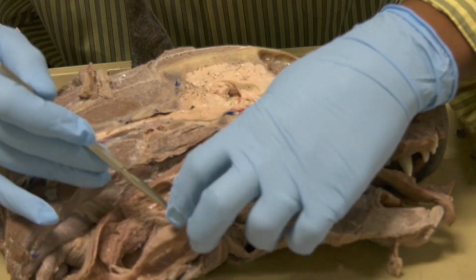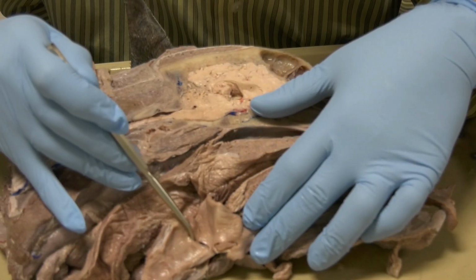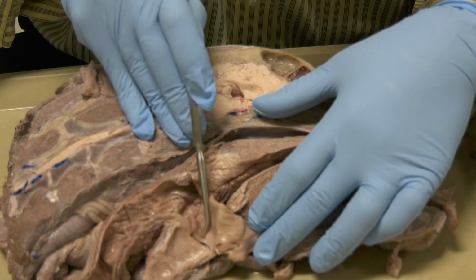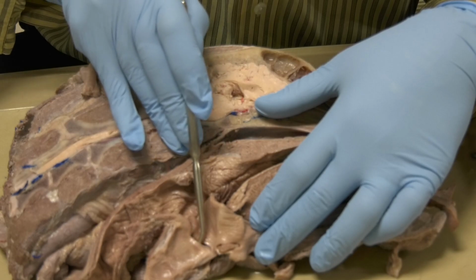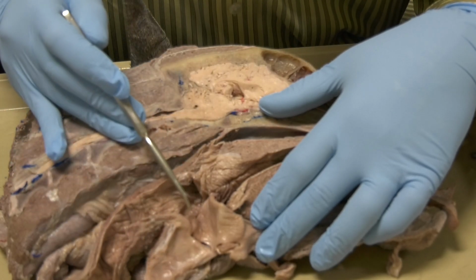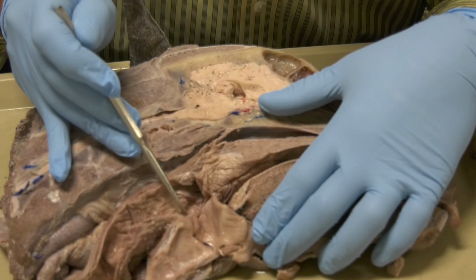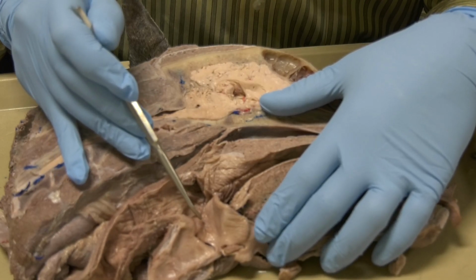Now, when we open the larynx here again, this is the vocal fold. Okay? This fold here is the vestibular fold. So vestibular fold, more rostral, and the vocal fold is the mucosal fold here. This is more caudal towards the trachea. Okay, this is the epiglottis. This is the corniculate process of the arytenoid cartilage. This is the cuneiform process of the arytenoid cartilage.